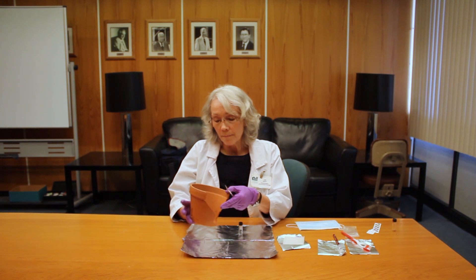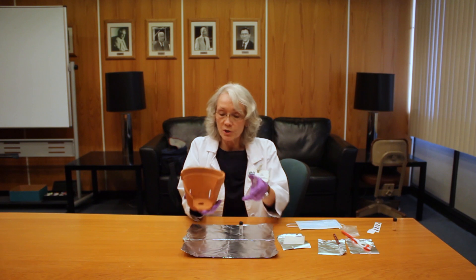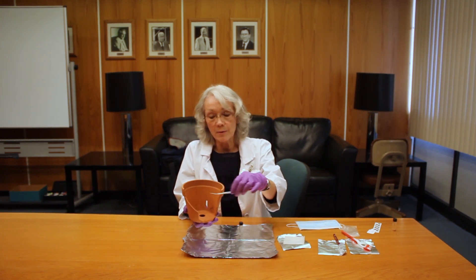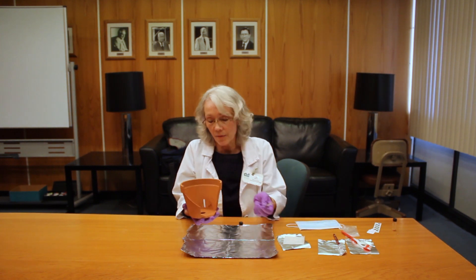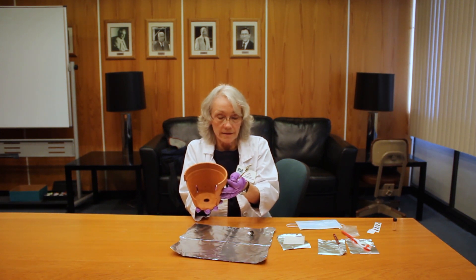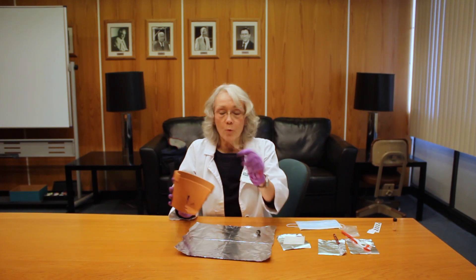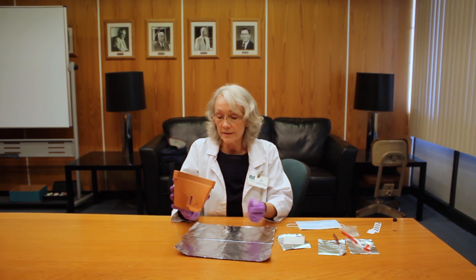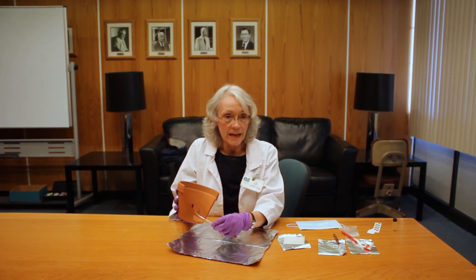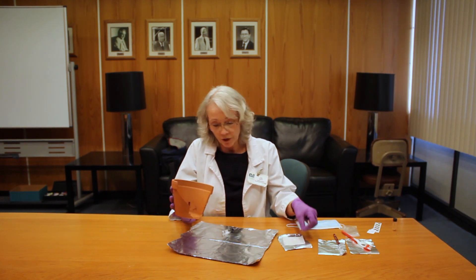You want to pick a spot where you're likely to get some good residue. In a nice flat-bottomed pot like this, I'm going to go for the base where anything that was in it in the past would have been sitting on the bottom, or along the junction of the base and the side wall. Wherever is accessible matters too — the size of the opening of the pot is going to determine where you can sample. I think we'll go right here; it's near a broken part anyway and it's easily accessible.